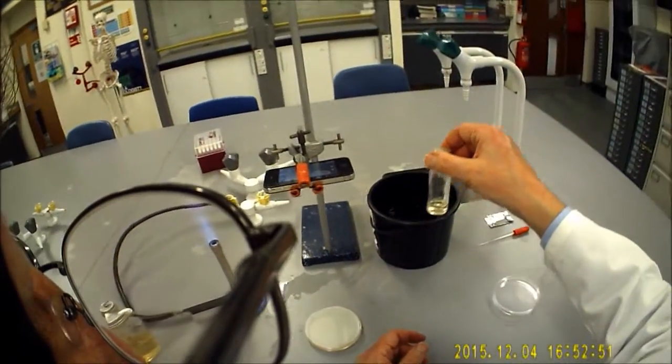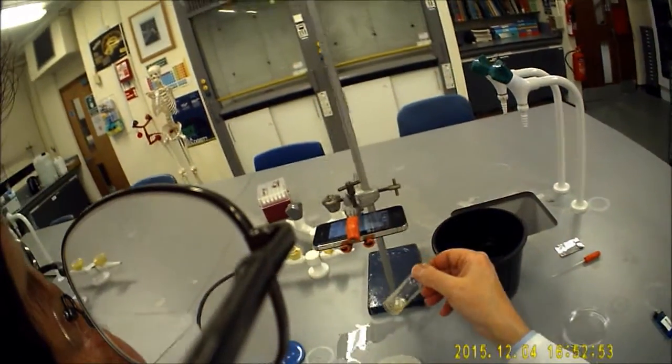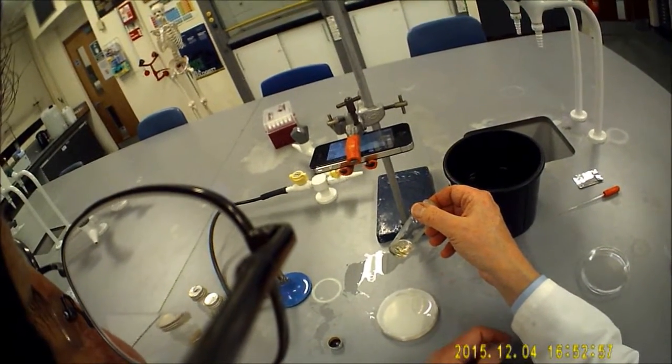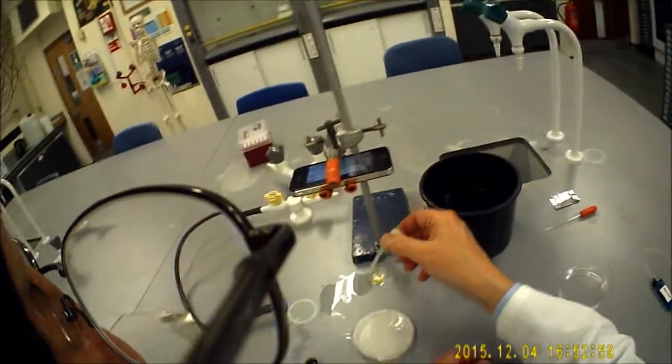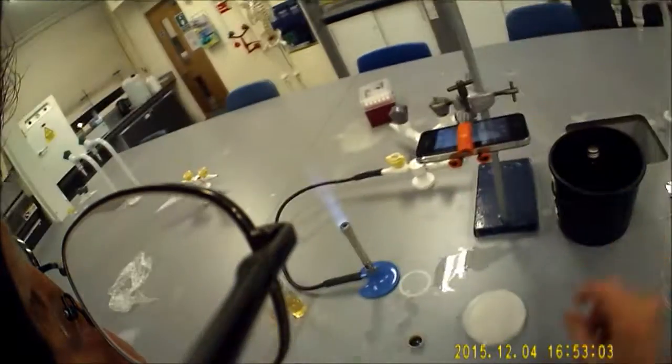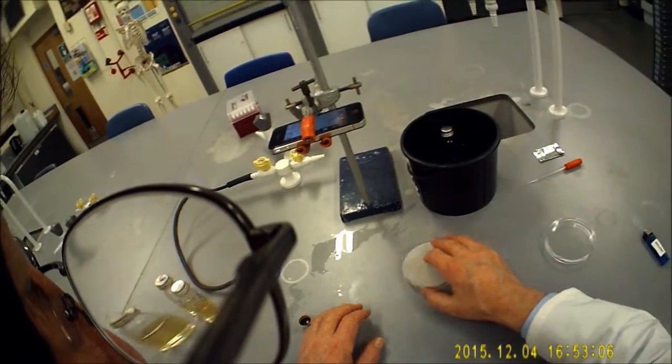I'm going to need this little amount of agar here to seal the bottom of the wells when I've taken them out. So I'm going to put this into the hot water as well, but with the stopper on, so that it remains molten. So that's number one.